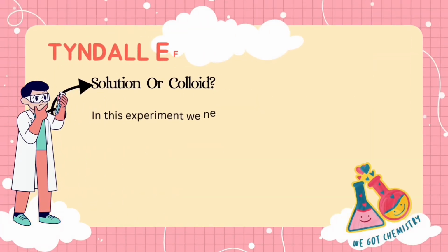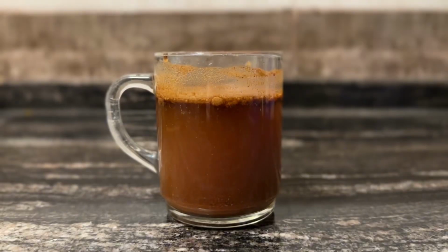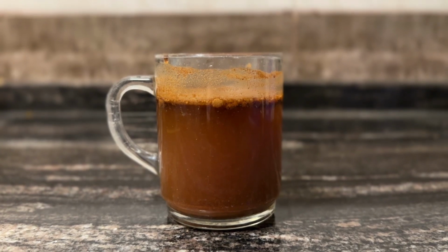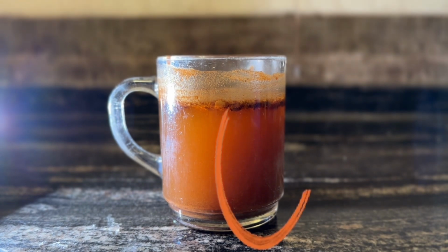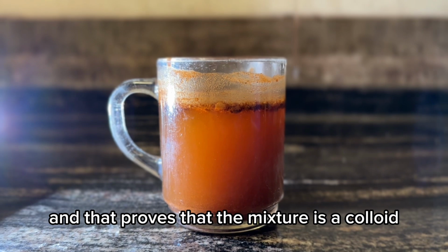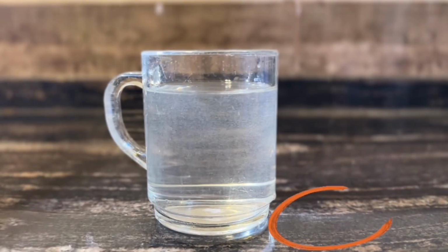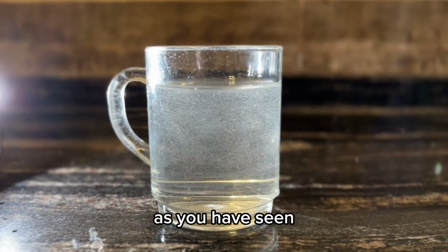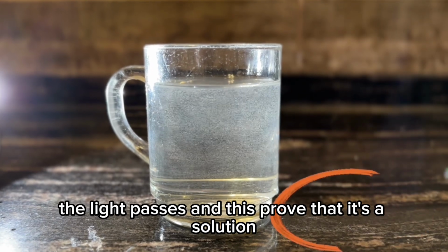We use the Tyndall effect to know if the mixture is solution or colloid. In this experiment, we need a flashlight, a solution mixture, and a colloid mixture. Here is the colloid mixture we made before. We get the flashlight. As you have seen, the light didn't pass and the mixture scattered the light. And that proves that the mixture is a colloid. And here is the other mixture we made earlier, which was salty water. As you have seen, the light passes and this proves that it's a solution.